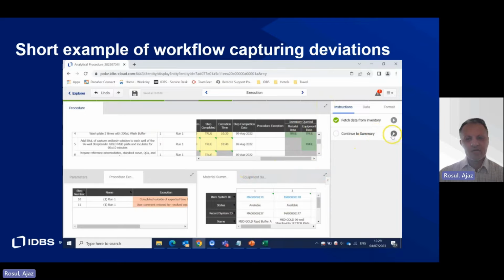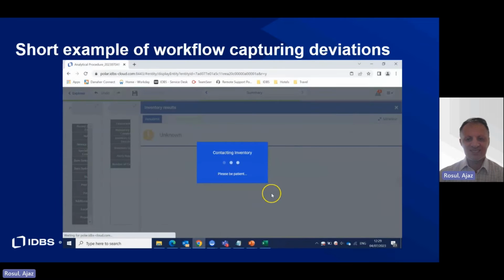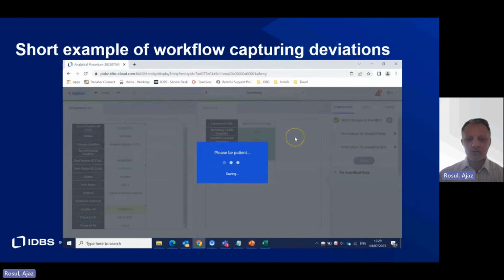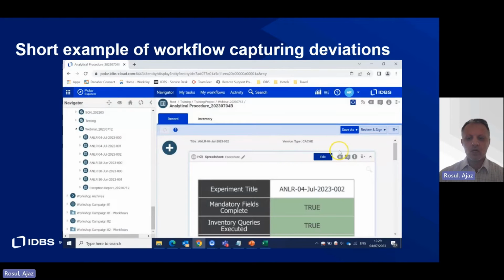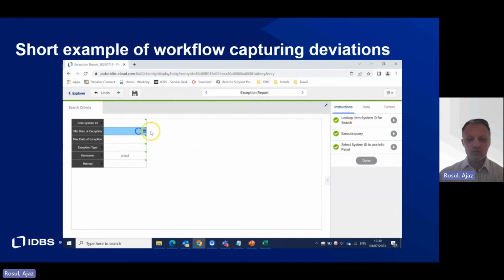In general, when deviations such as expired material or uncalibrated equipment occur, it's vital that this is picked up during any analytical process in the lab. Calibrators and QC samples can be created using built-in templates and referenced within a run experiment. Using templates that simplify data capture throughout the experiment mitigates the risk of missing and incomplete data, reducing errors, promoting efficiency and reproducibility, and driving quality.